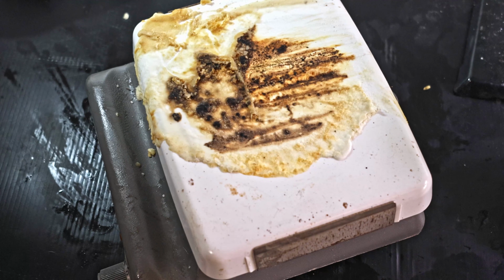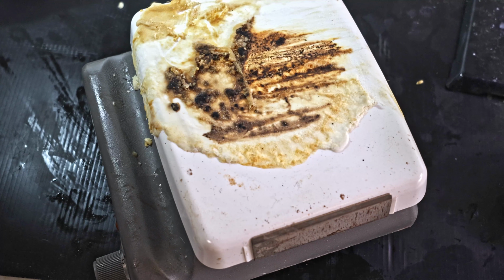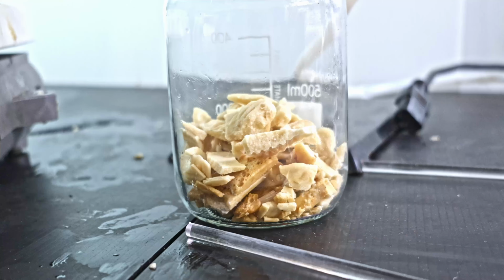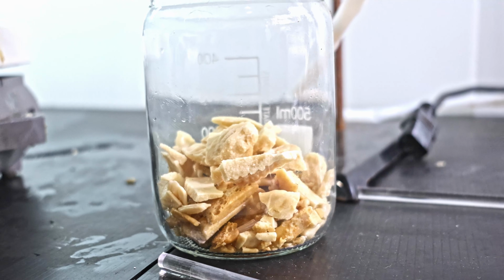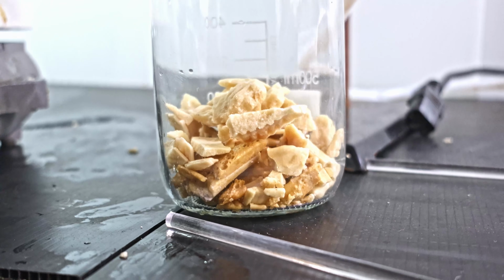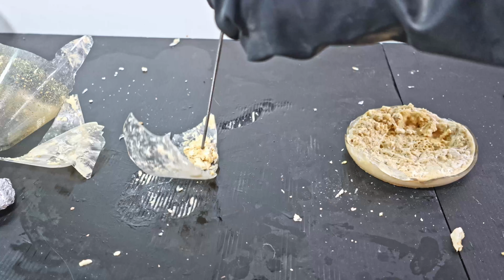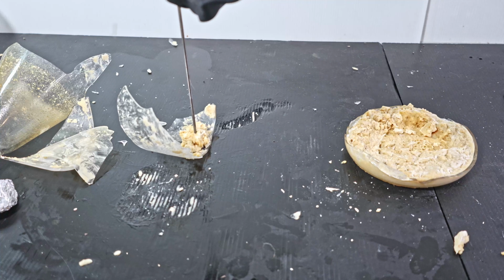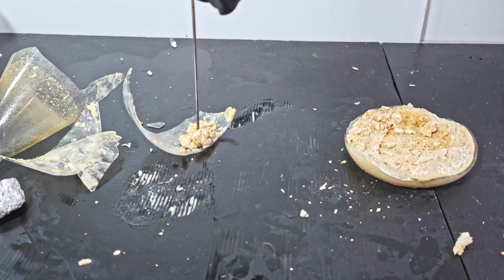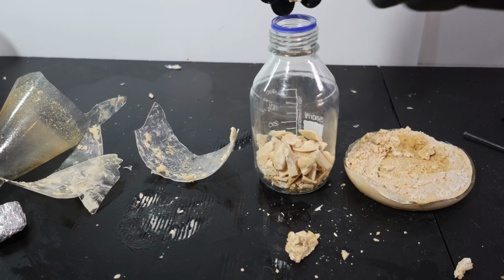Luckily, it didn't reach the outlet, which I think was what destroyed my last hot plate, but it was still pretty bad. On the upside, it provided a way to extract at least some potassium ethoxide. All this was collected from my hot plate, by the way. I still had some stuff stuck on the flask, and since there was already a leak, I might as well break it. I collect what I can with my titanium rod and hammer. It helps to break up the chunks to fit in the bottle.